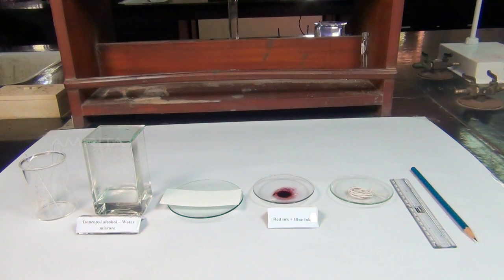Our aim here is to separate the components from a mixture of red and blue inks by paper chromatography.